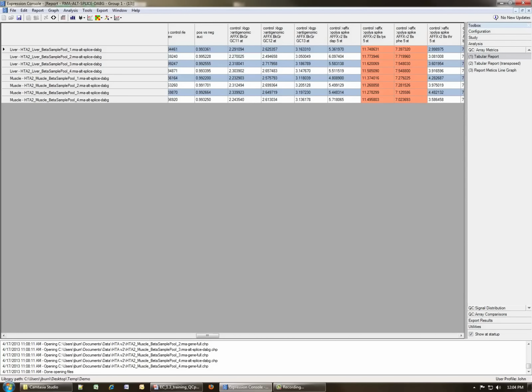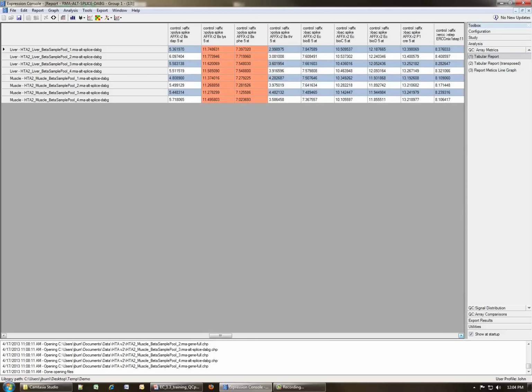And we get along here to two sets of metrics that have backgrounds that are orange, which means that they violate the thresholds that we've set up. In this case, we can see that it's both the lys and the phe. And if you remember from the first part of this talk, I mentioned that if you use both the ERCC mix and the labeling controls at the same time, that you end up messing up the expected behavior of the lys and the phe probe sets. And so that's exactly what has happened here.